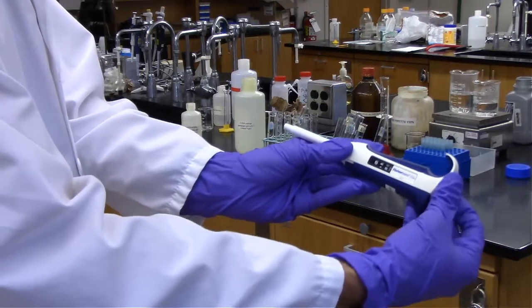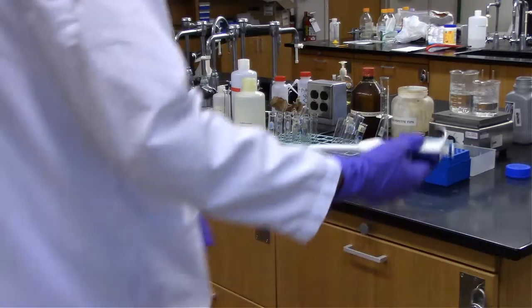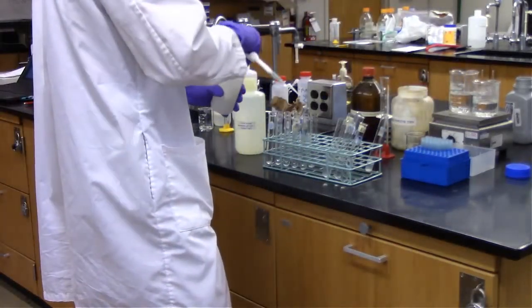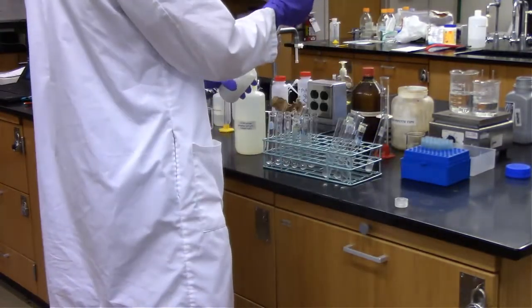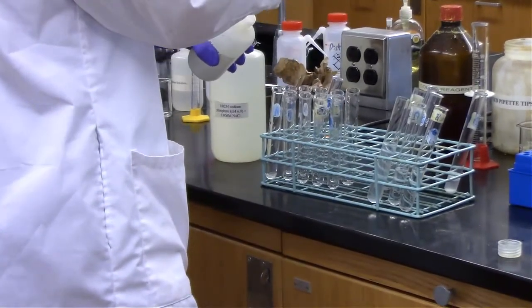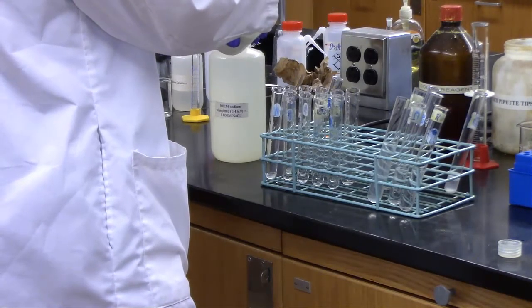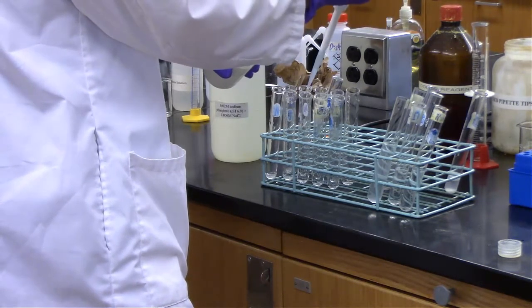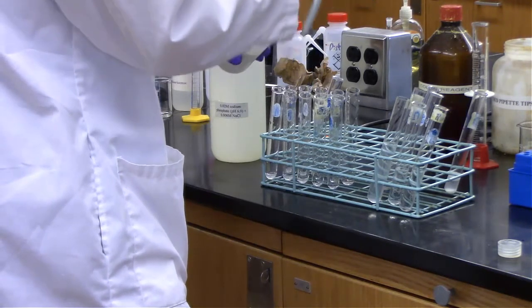All right, as we continue, we're going to prep for the effect of temperature on enzyme activity experiment. So we're just going to go forward with the 1 to 10 dilution that we have and set up for the different temperature baths. As I set that up, let's talk a little bit more about the effect of concentration on enzyme activity. For the 1 to 10 dilution, we definitely had some enzyme activity. So the alpha-amylase was undoubtedly breaking down that starch, making glucose or maltose equivalents, which is why we had the large absorbance for the 1 to 10 dilution.